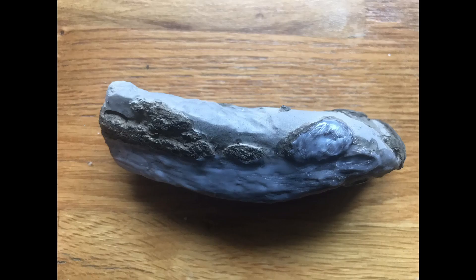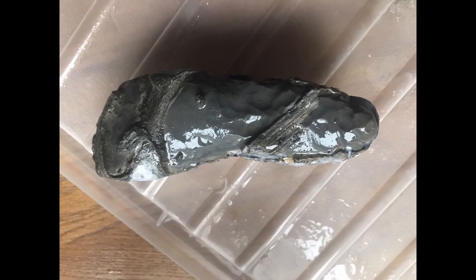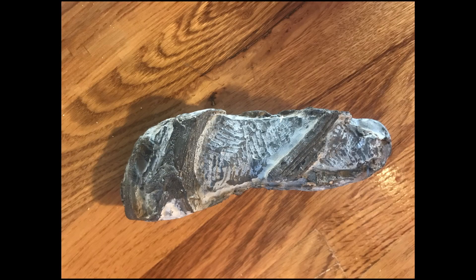The number of cycles is very much dependent on the fossil itself and what you're trying to expose. For me, I was trying to figure out what these little tiny bits of bone sticking out the side of my block were — were they scales or something else? I'd suggested maybe fin rays: the little cartilaginous rods in fish fins that help them keep their shape.